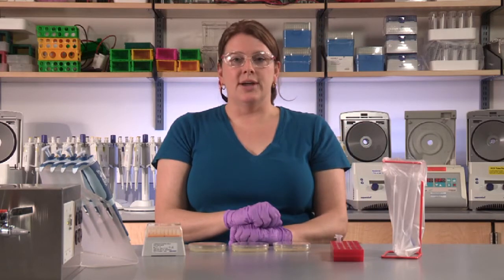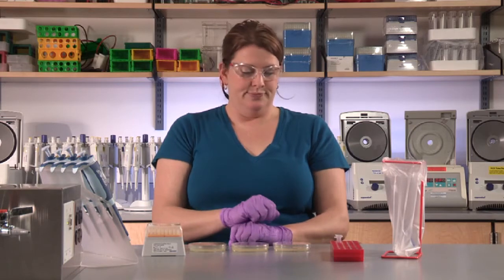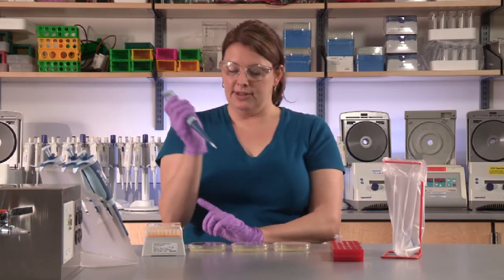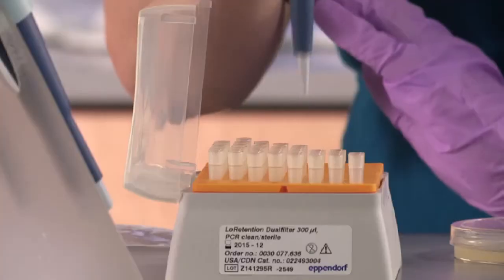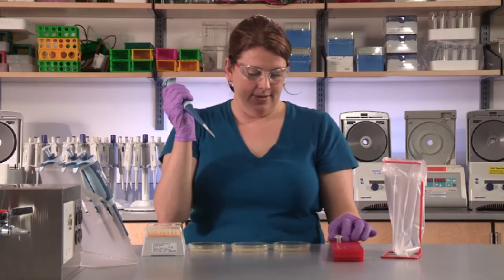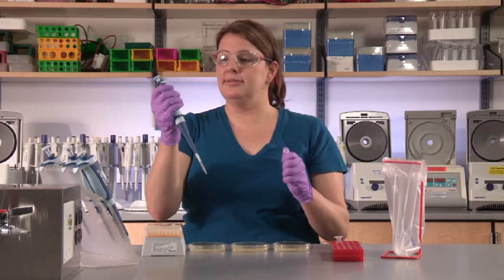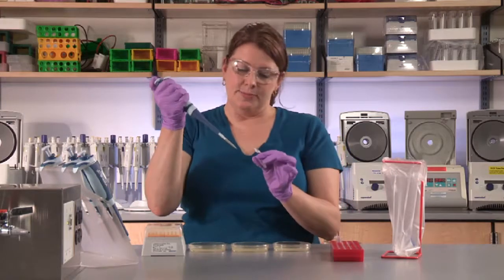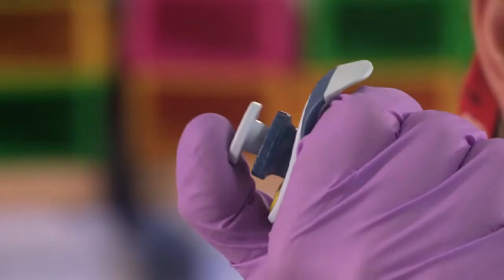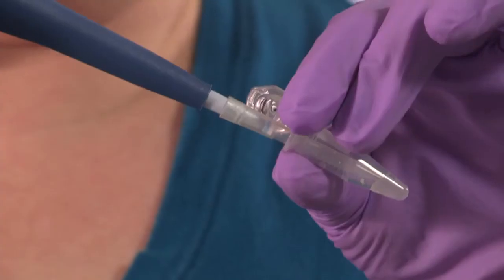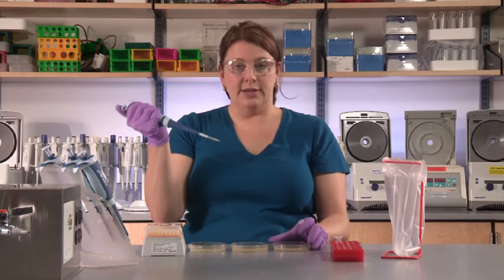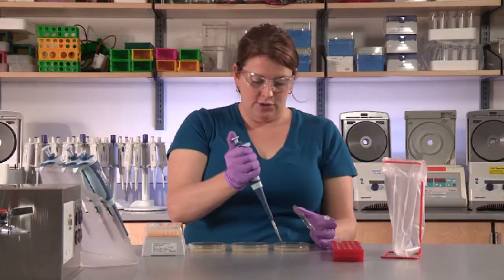Now you're ready to dispense the P+ cells. Again, pick up the pipetter set at 50 microliters. Put a tip onto the end. Pick up the P+ cells. Gently depress the plunger with your thumb and mix the cells up and down in a gentle fluid motion.